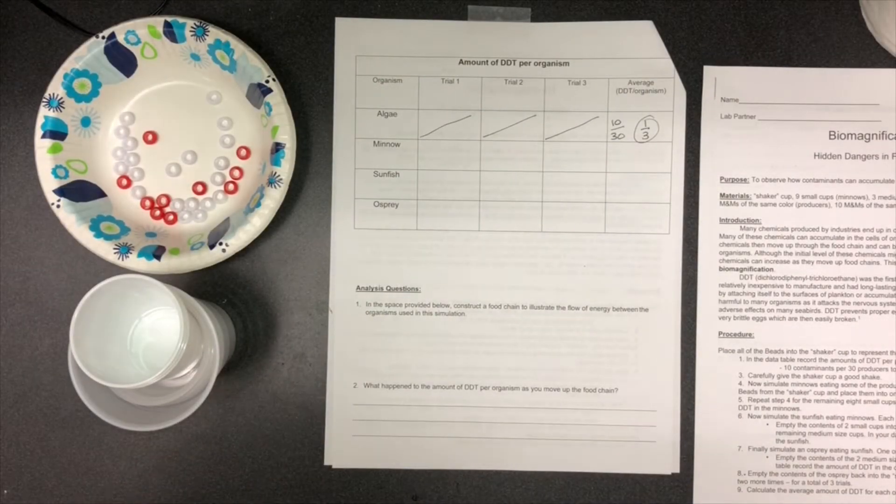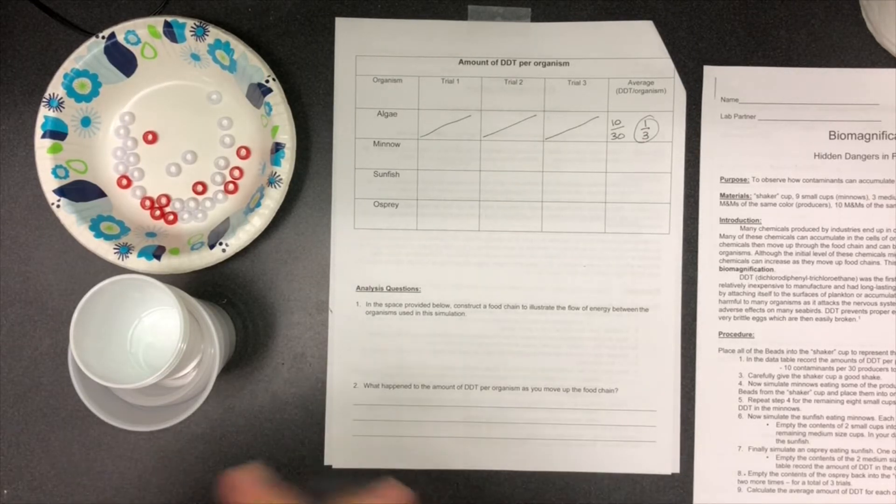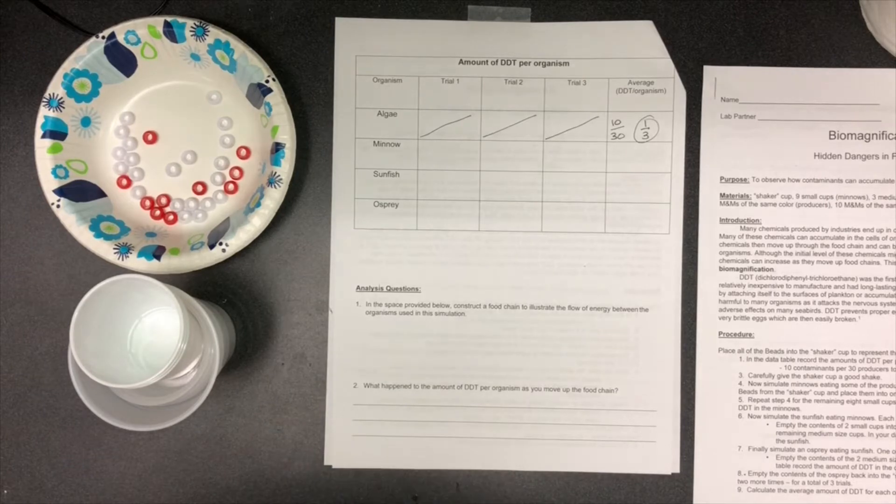Hello students, welcome to the biomagnification hidden dangers and food webs lab. I went ahead and made this YouTube video to talk a little bit about the materials every group will have, as well as the procedures you will follow, just so that it's easier to explain and you can all see what I'm doing here.